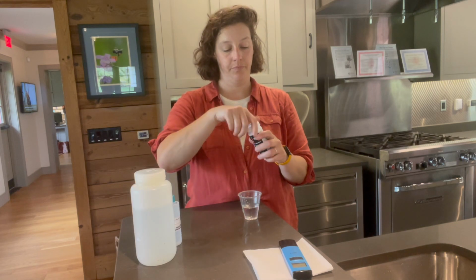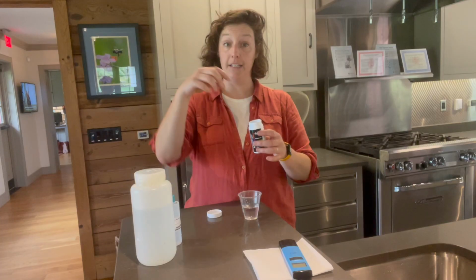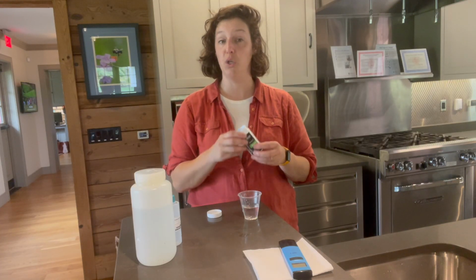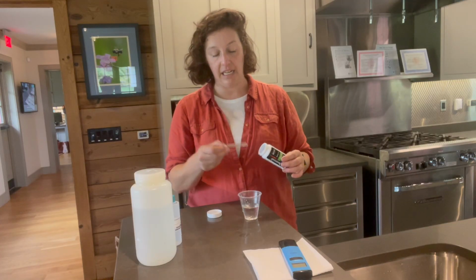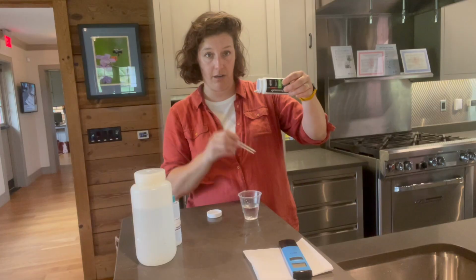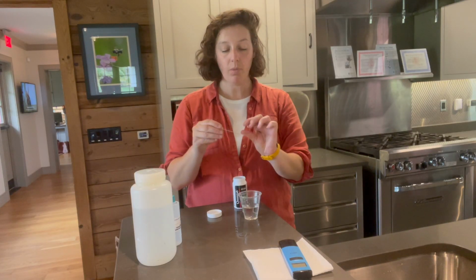So when we are taking our chloride strips out, if your hands are a little wet from handling your sample collection, please do not reach in. These chloride strips are really sensitive to humidity and temperature. So they shouldn't be stored in your car in the summertime. They should stay in a temperature controlled space. And then we want to avoid introducing any humidity into the container. So I like to pour the strips out just a little bit, so then you can pull the strip out without getting all of them wet.